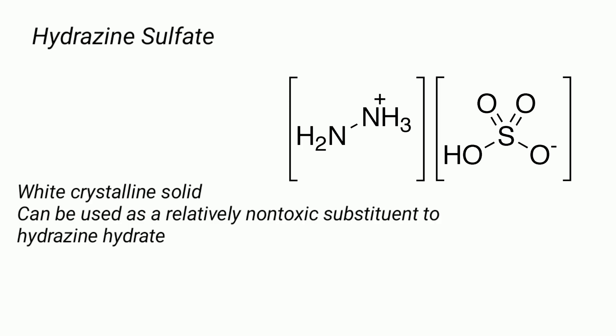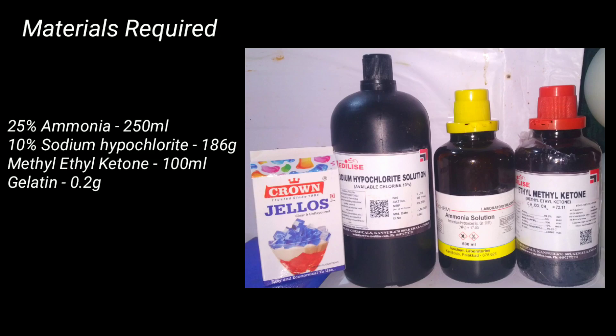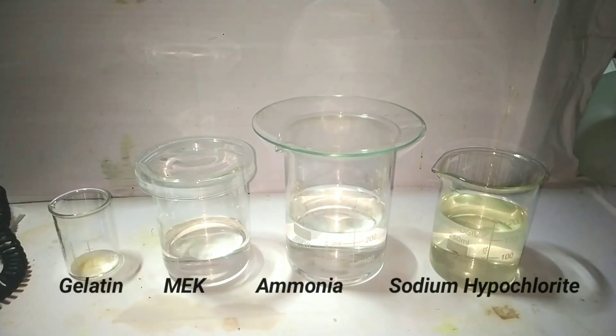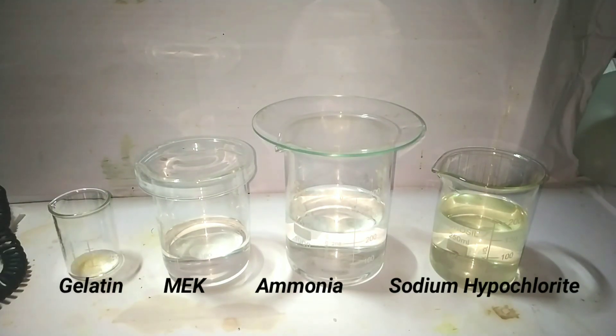We will be using the hypochlorite ketazine pathway for the synthesis. Materials required include 250 ml of 25% ammonia, 186 grams of 10% sodium hypochlorite, 100 ml of methyl ethyl ketone, and 0.2 grams of gelatin. These are all the reactants arranged after accurately measuring them.